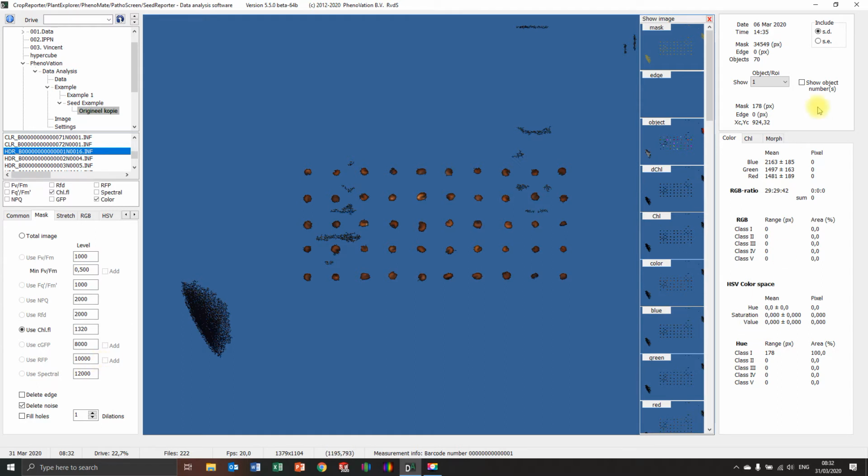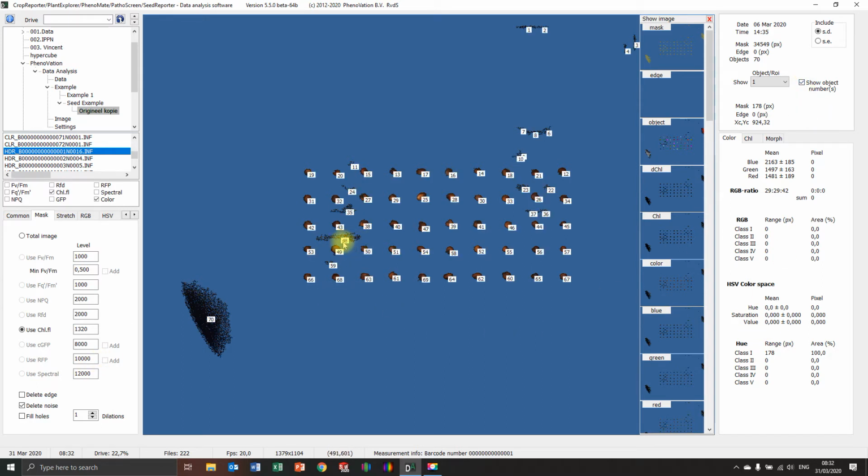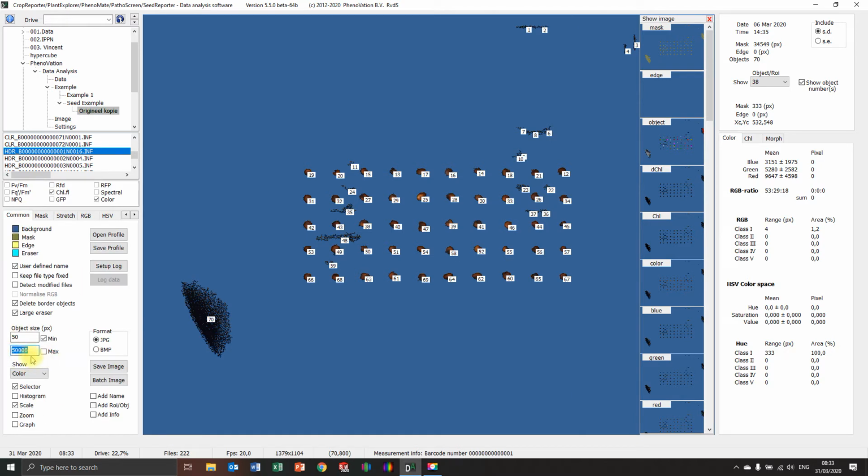1320. And now show object numbers. And I can see like object 48 is 790 pixels. The seed is 200 pixels. The very biggest seed is 300 pixels. So let me use this setting. Let's keep it on the safe side. Everything above 500 will be deleted. Switch it on. There we go already. Now I can lower it like this, 21. I'm not going to lose it. It's 87 pixels. I'm just going to lower this to 400 and see what happens.